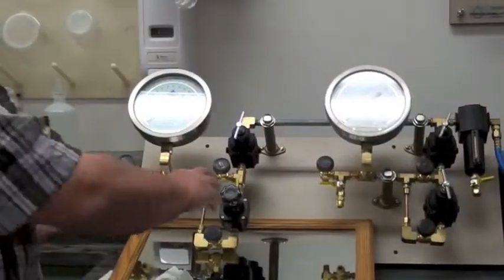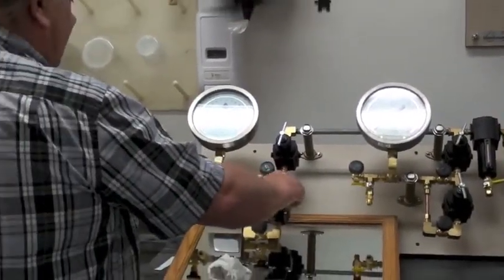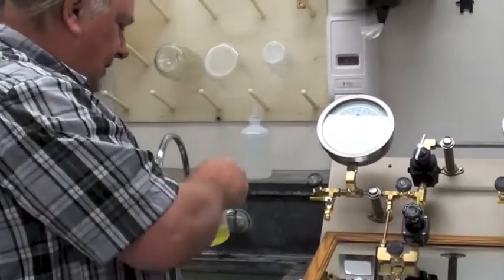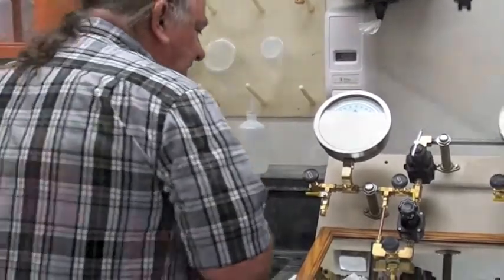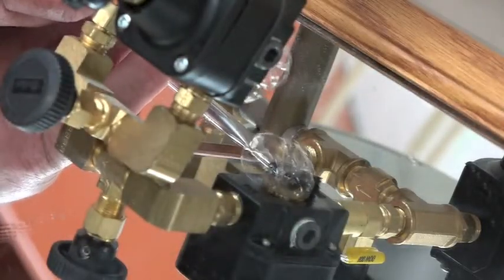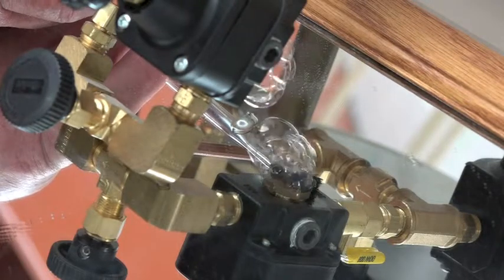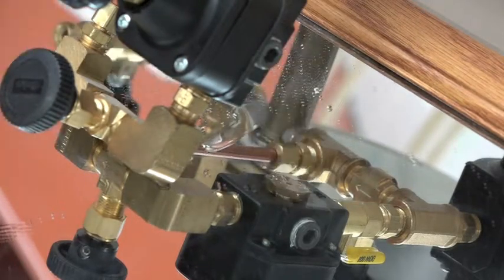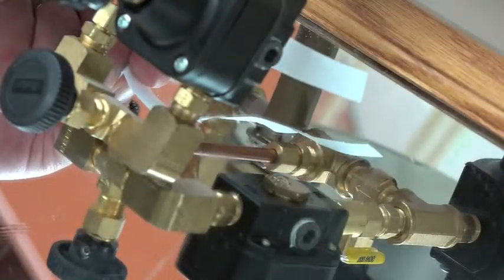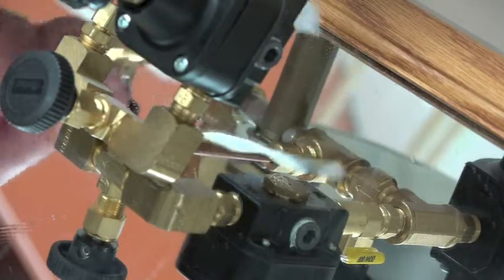Okay, now we'll take the Nullmatic up to some pressure. Let's go to 1.5 bars, okay? Then we try again and see if anything's changed. As before, it's leaking at about the same rate. This is completely normal. Once again, you put this paper back here and you see no major movement.